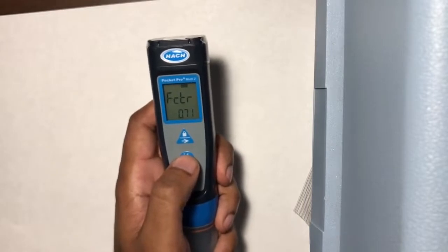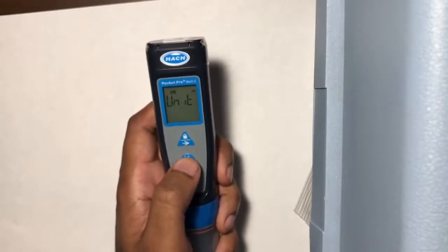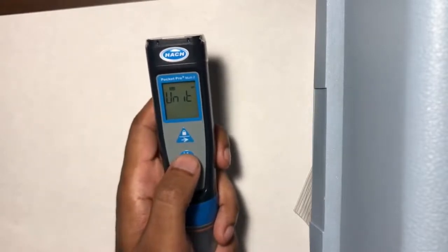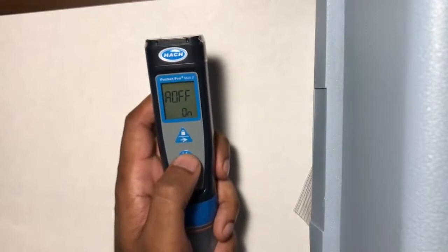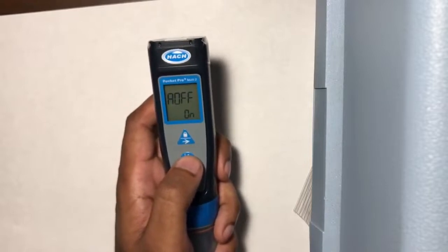FCTR, this affects the readings for total dissolved solids, or TDS. That's to be set to 0.71. Salinity unit, you can tell the difference from the previous temperature unit parameter because the black bar reading SAL is on top. This changes the unit that salinity readings are displayed. We want this in PPT, or parts per thousand, and not percentage. AOFF, that's just a timer that tells the machine to turn itself off after 8 minutes if it's not being used. We want that on, obviously.